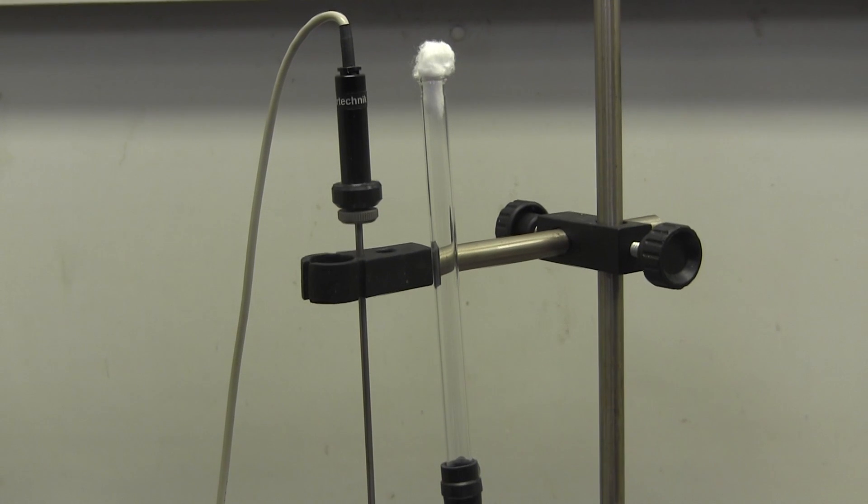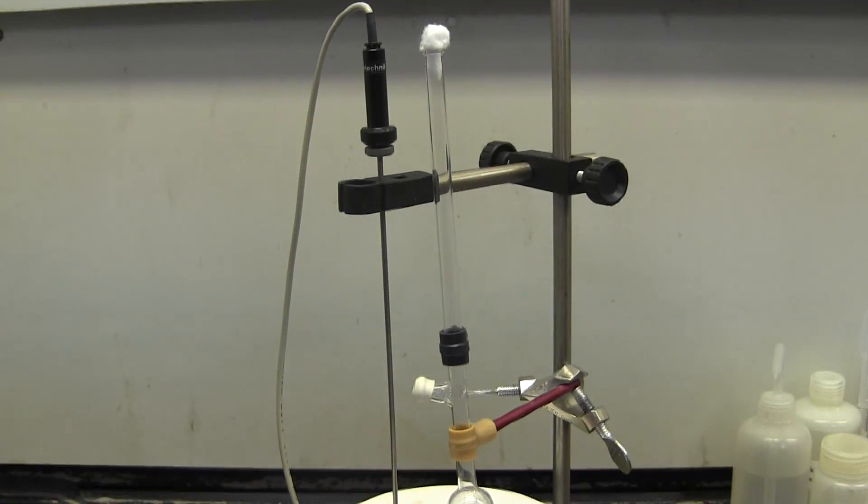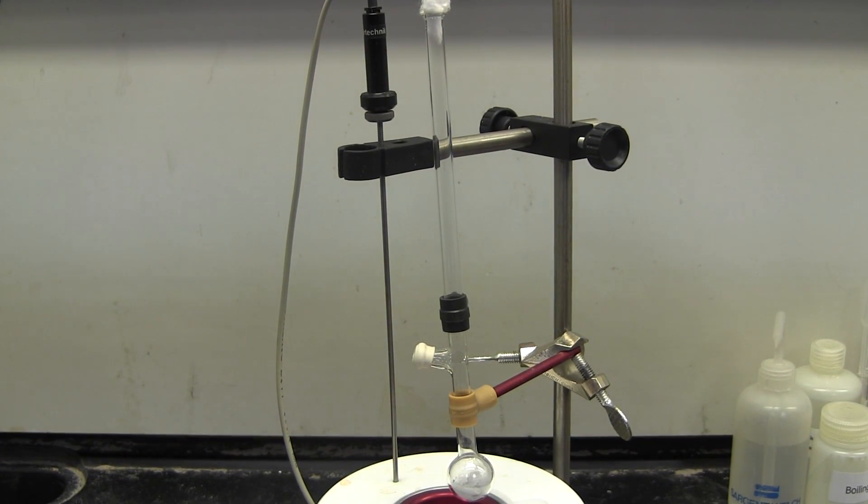Set up the Microscale Condensation Kit to run this lab. Follow the procedure in your lab binder to reach the successful conditions.